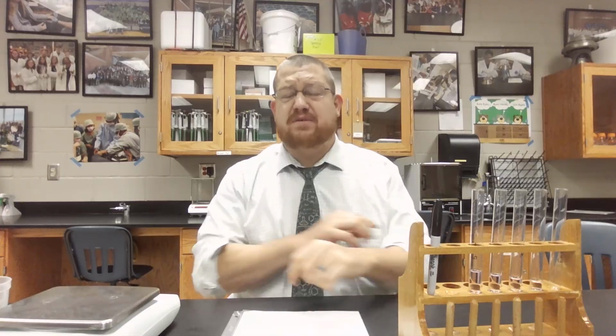So using this knowledge, we are going to pipette out some liquid water, and then we are going to take the mass of it, and then we'll use our percent error formula to determine how accurate we were with our pipetting skills. So to just give an overview, in the yellow here, I know you can't make this out, these are all our theoretical yields and what we should end up with at the end of this. So this is a great time to talk about variability in equipment and how that could impact something we need to be specific with.